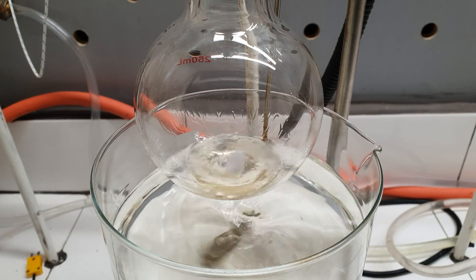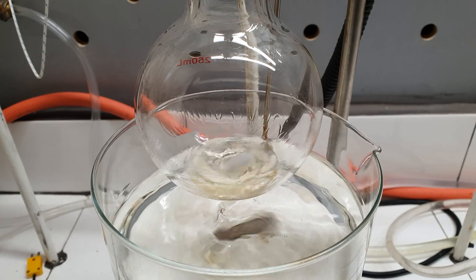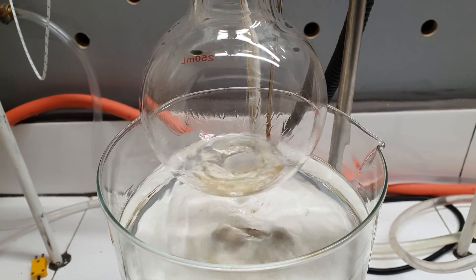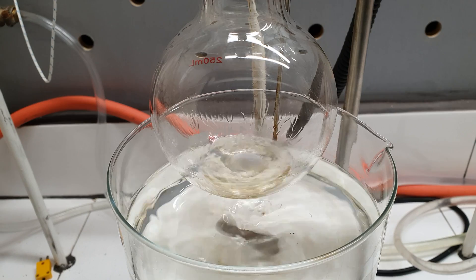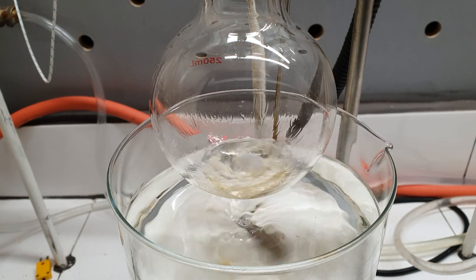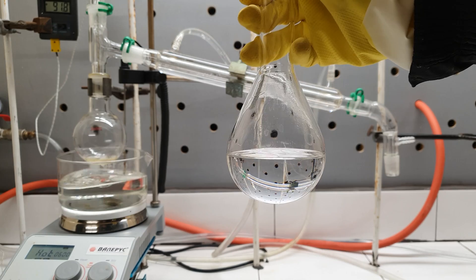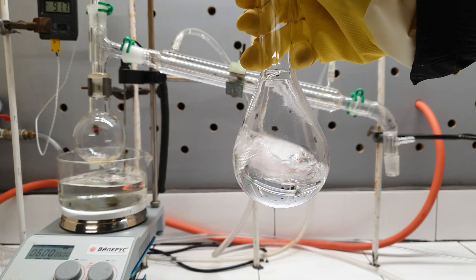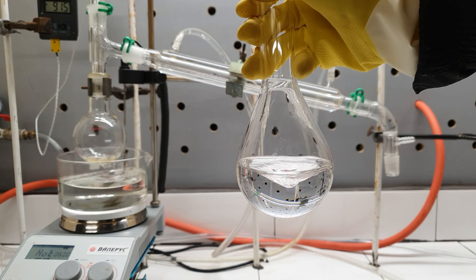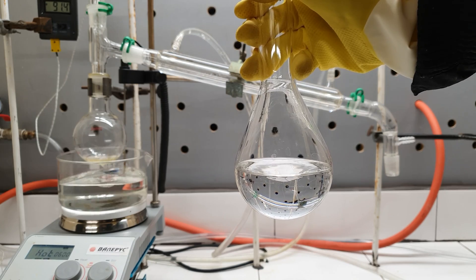In the distillation flask I was left with some high-boiling liquid, which is probably dibutyl ether, released as a side product. My final yield was 136 grams, which corresponds to a percent yield of 83.4%.